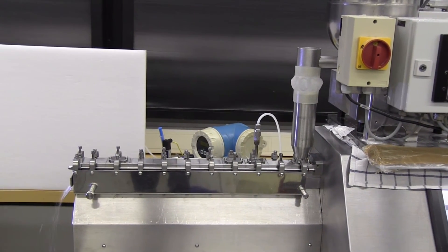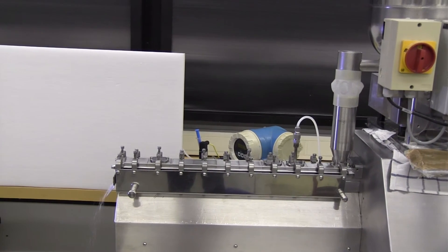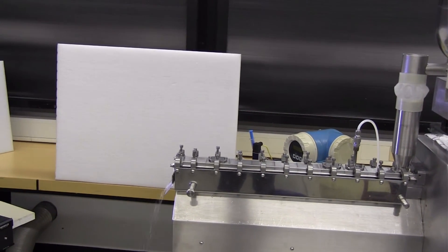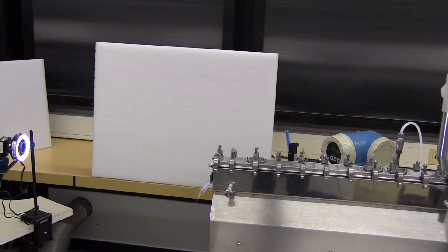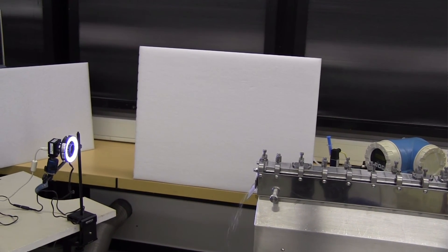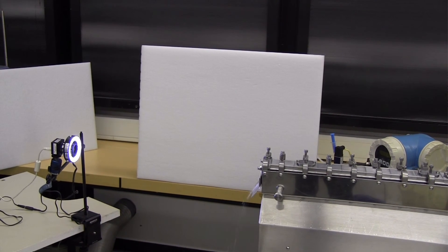As soon as the binder gets mixed with the dry powder, agglomeration occurs and the resulting particle size is determined by different parameters — including the ingredients in the formulation but also process parameters like screw speed, feed rate, and screw configuration.